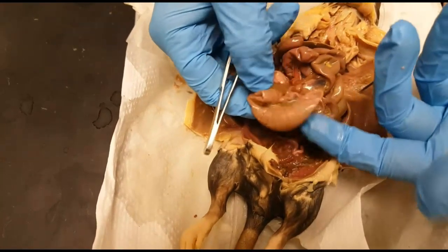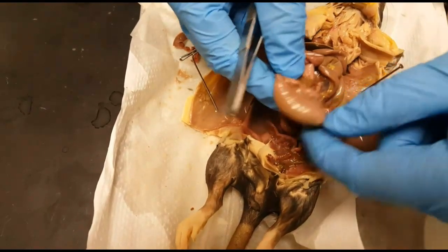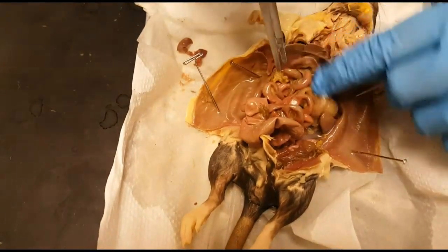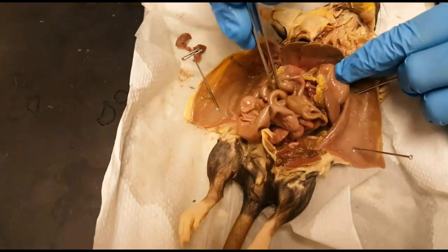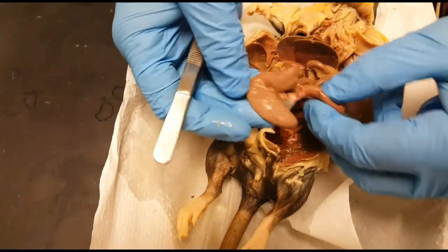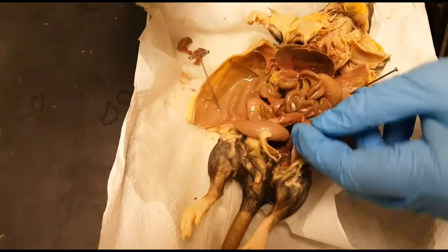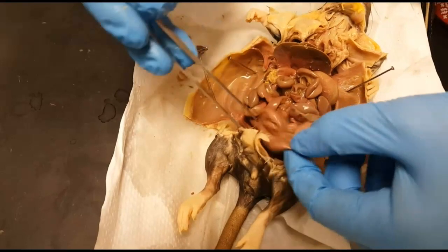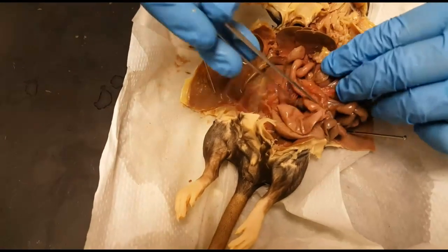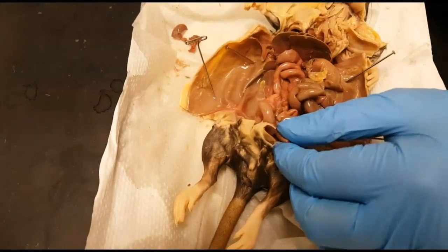The last part down here is the cecum. So the small intestine is made up of the duodenum, jejunum, and ileum, and then we have the cecum that separates the small from the large intestine. Extending after the cecum we have the large intestine, which goes up — ascending — then crosses as the transverse colon, then down as the descending colon, and eventually goes into the sigmoid and the rectum.